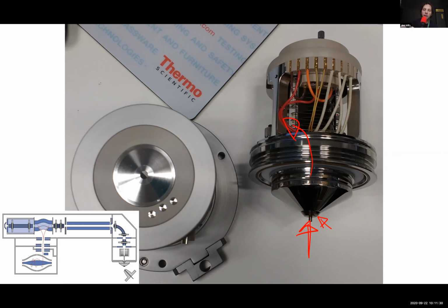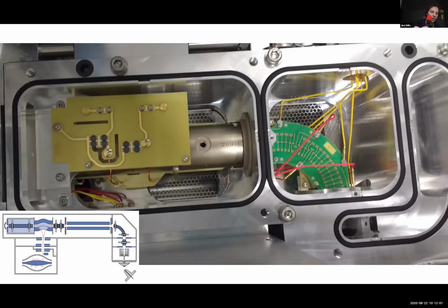So this thing here, which has several names, an API stack, a SRIG, an S-lens, and I've heard them used interchangeably, even though they have very specific meanings. Whatever, it's some kind of an ion funnel is what it is. It takes these spreading out ions and focuses them into a beam, which can then be more easily manipulated by electric fields further into the mass spectrometer. This is now a view down the top of the mass spectrometer, and if you look at the schematic, this is the area we're talking about.